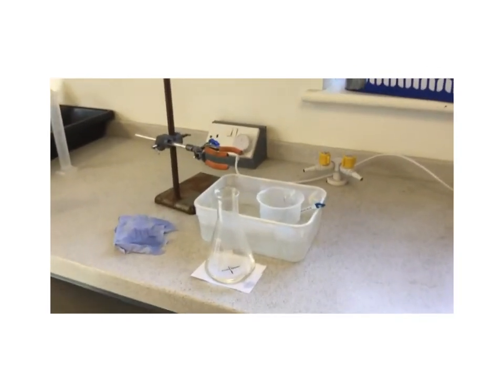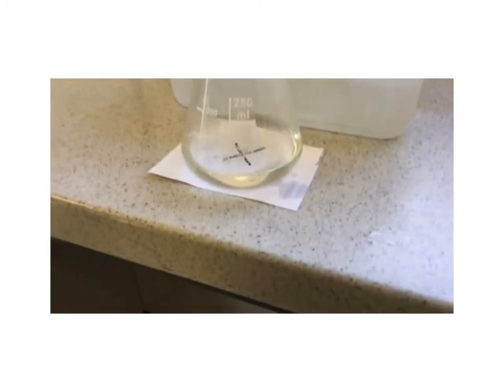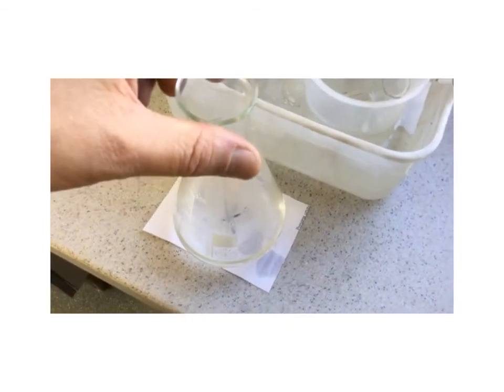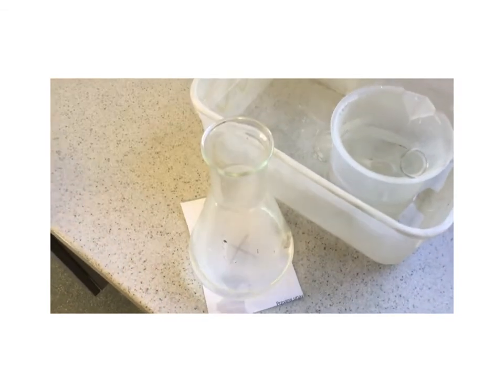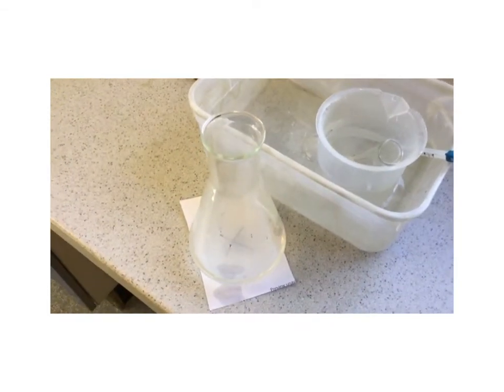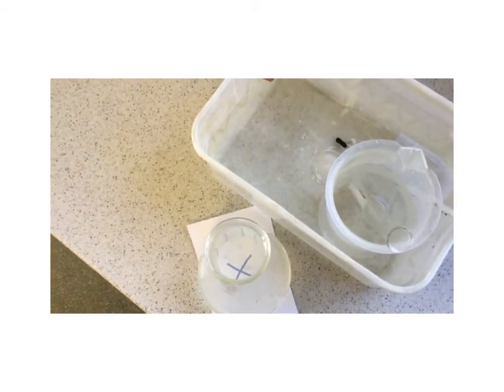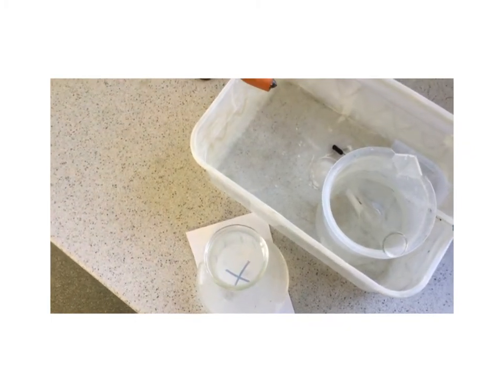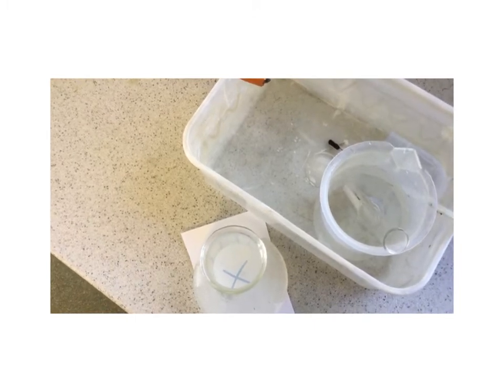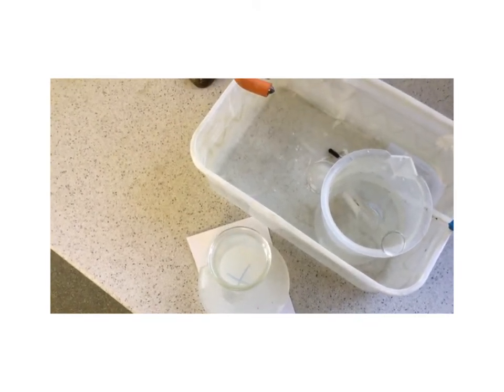Obviously the reaction is going on all of the time, and the precipitate will form, and at a certain time there'll be enough precipitate that you can't see the cross. Now, the key thing here is that the time that it takes for the cross to disappear is inversely proportional to the rate of the reaction. So if the time for the cross to disappear is short, then the rate is high. If the time is long, then the rate is low. So it's an inversely proportional relationship between the time and the rate of the reaction.